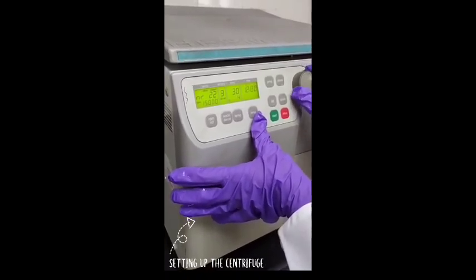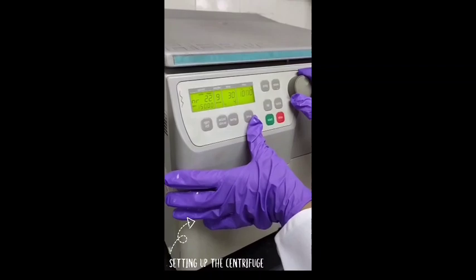Once all the parameters are set in the machine, we can start the machine and wait for 10 minutes.